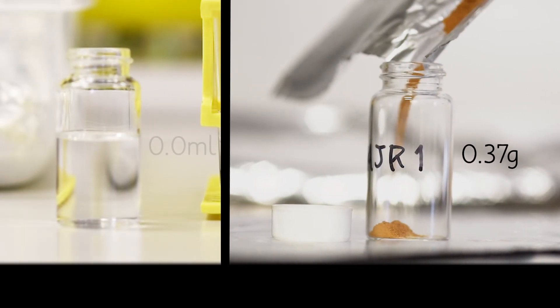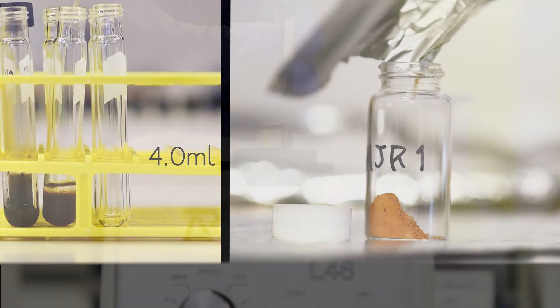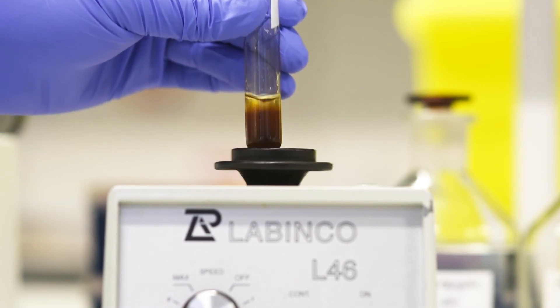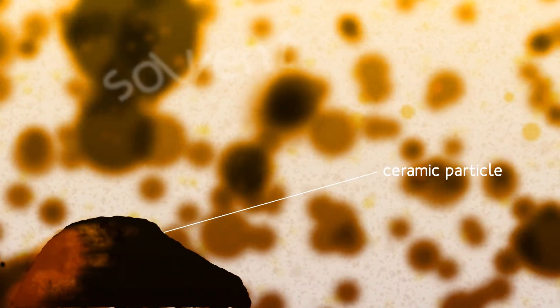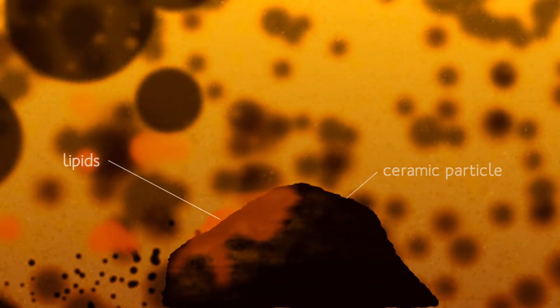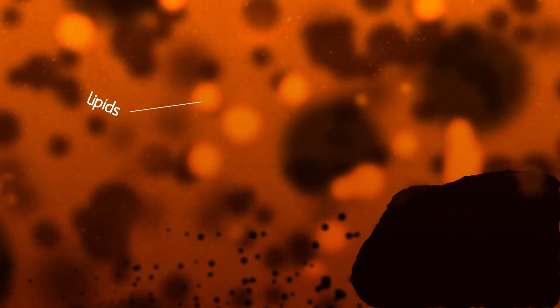We take the powder, add an organic solvent and mix it thoroughly. We then place the sample in a sonic bath. The solvent dissolves the compounds called lipids, which is the general term we use for fats, oils and waxes. The solvent pulls them away from the fabric of the pot, similar to the way detergents remove food stains from clothes.